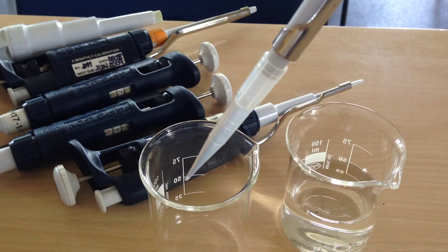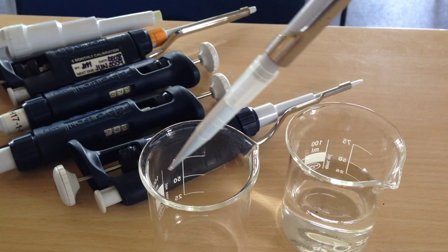If you try and tip it like this, you're going to be getting water going up into the base of the Gilson. And I've had to take many Gilsons apart and clean them. It's not a fun job.